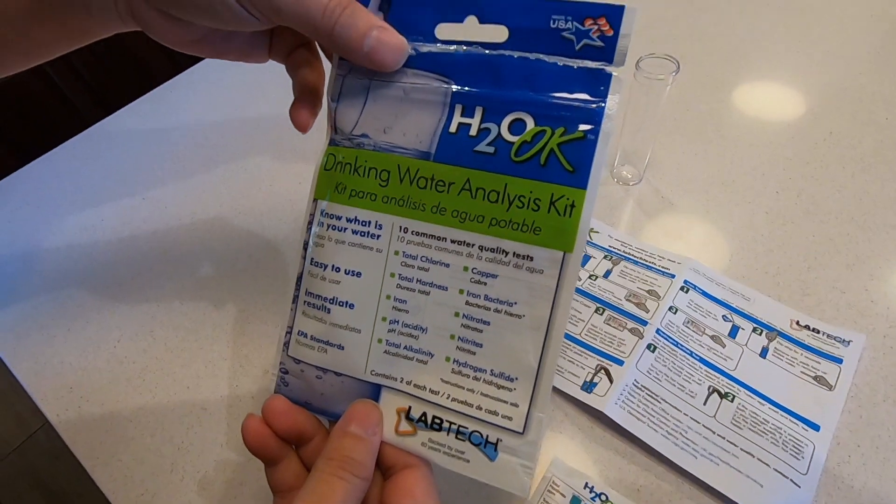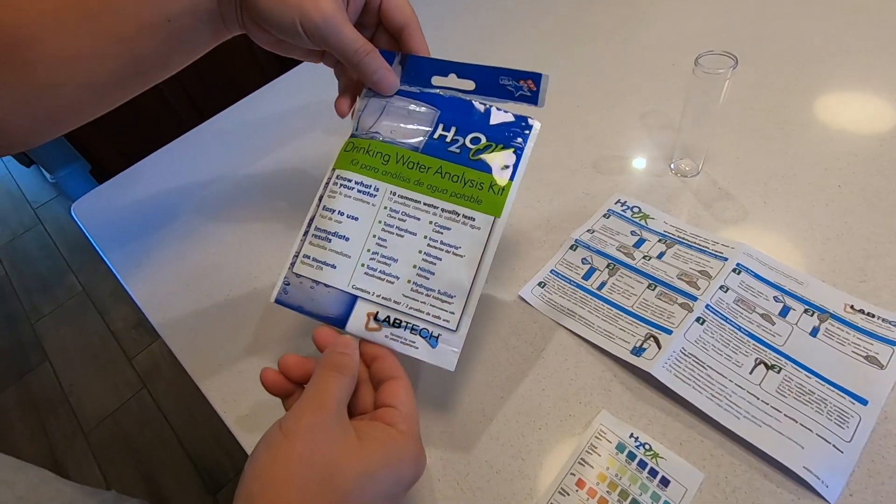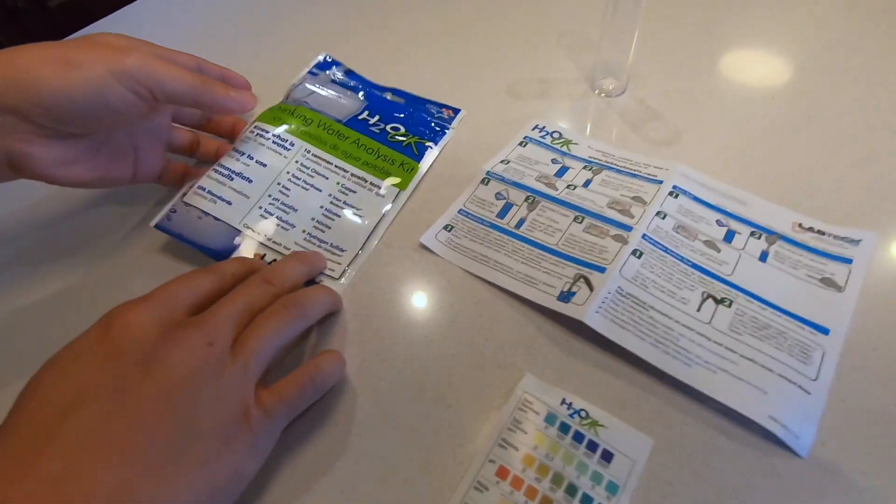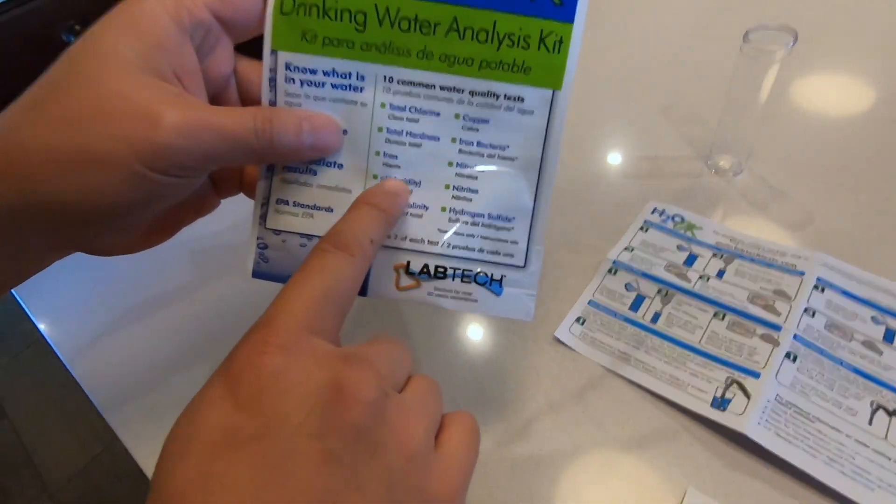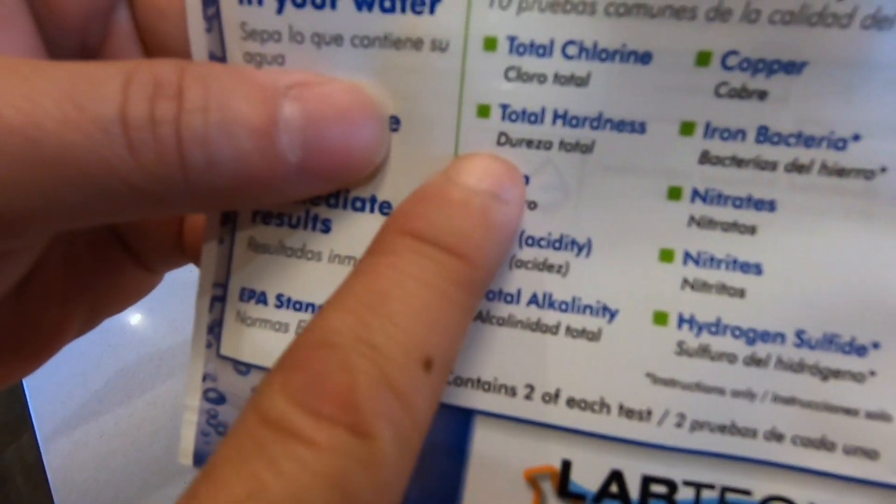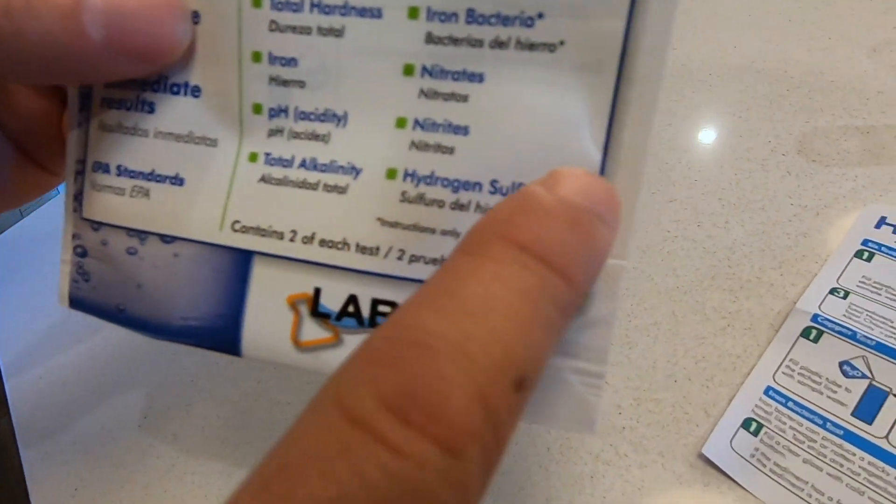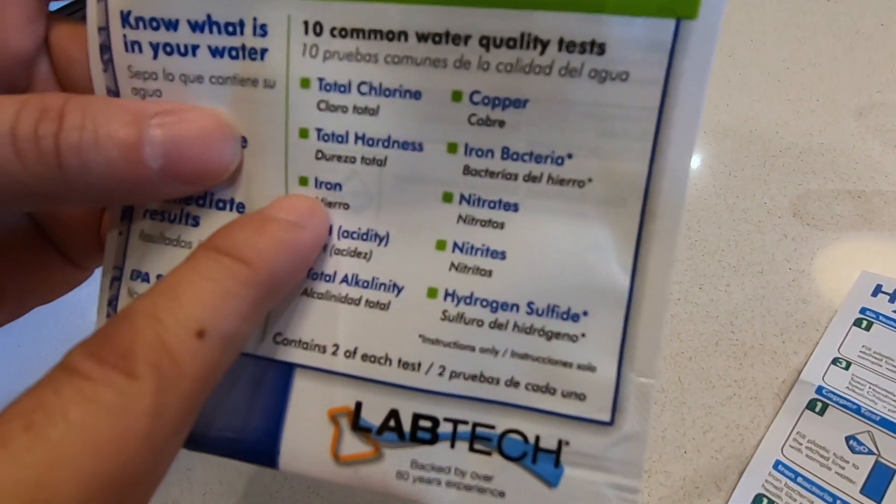My wife wanted to get a water softener and we need to get information about how hard our water is, the total hardness and also the iron which is right here.